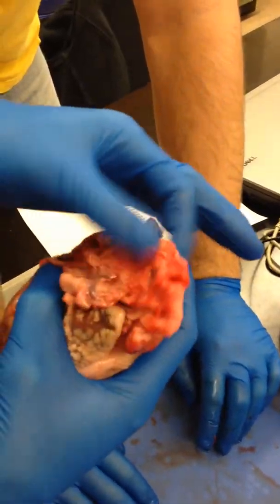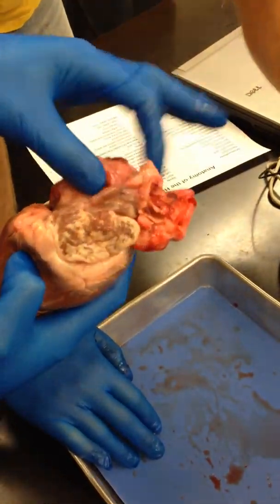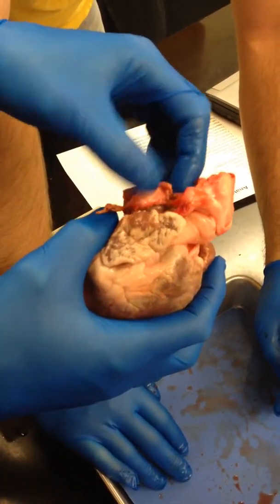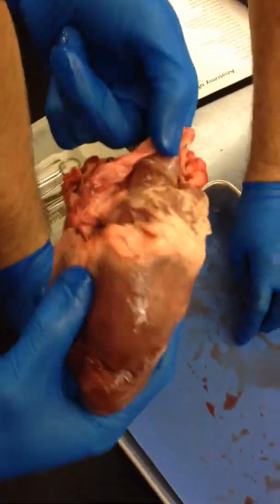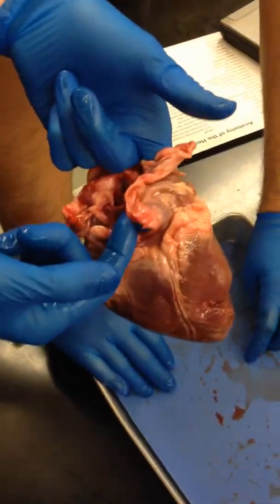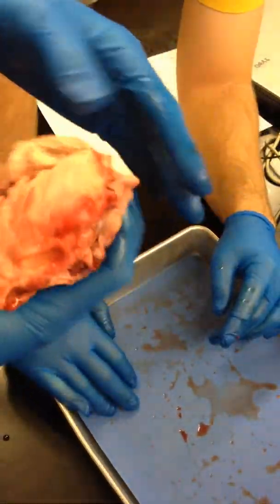Squish that and it just springs right back. And so your right atrium is going to be up here. Looks like this is something — is there an opening up here? Is that little guy right there? That's where we're looking at. That's the inferior vena cava. So superior and inferior — it's all going into this. That's why it doesn't go all the way down. It's been cut off.